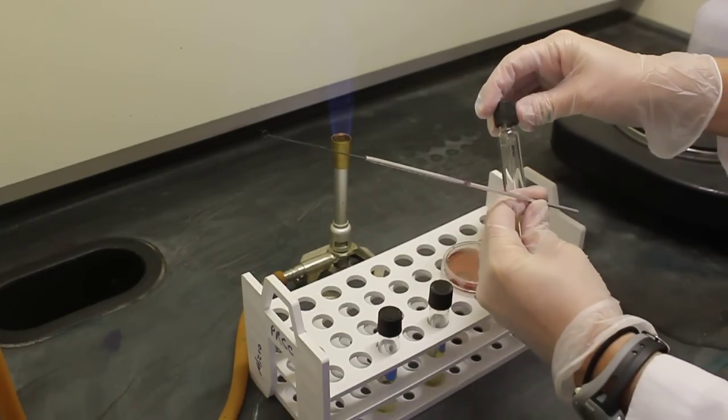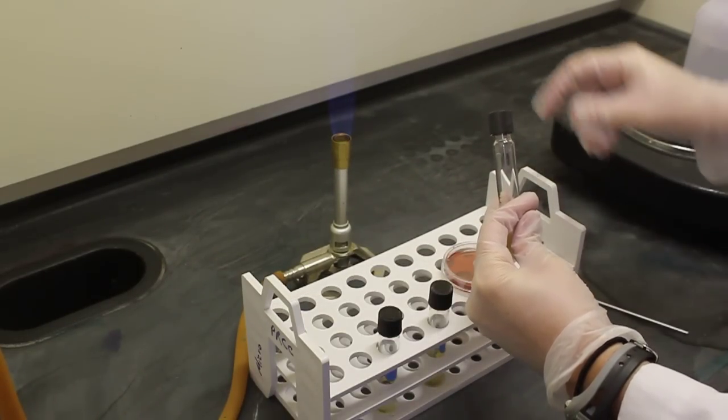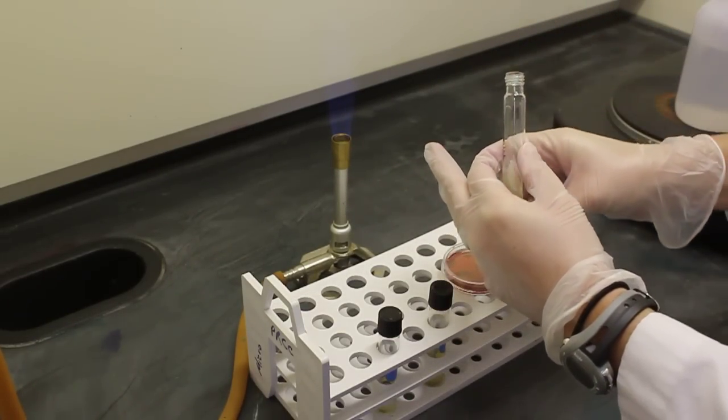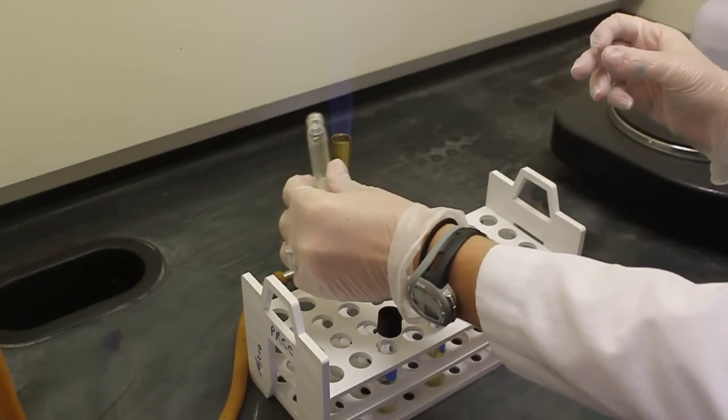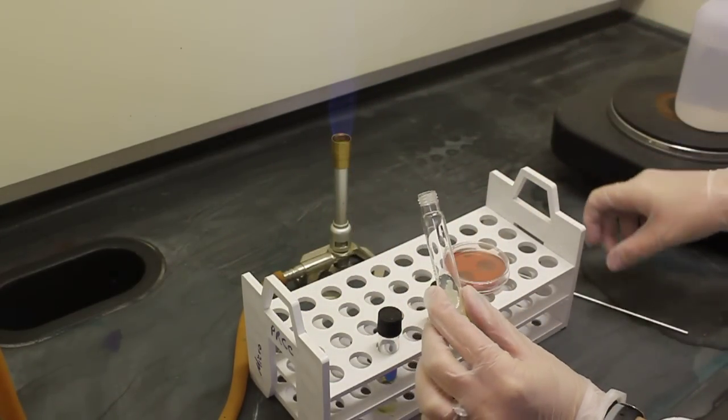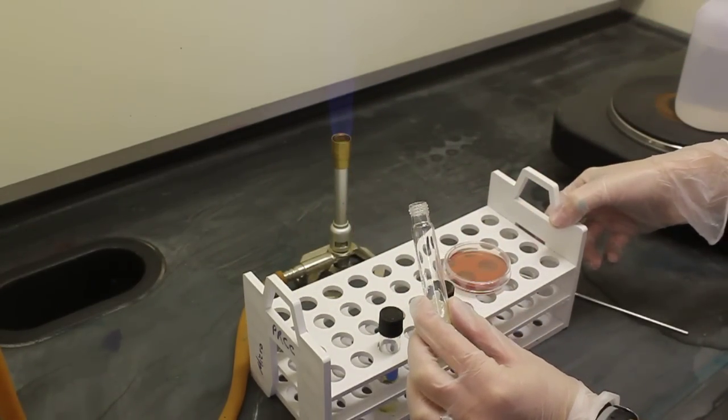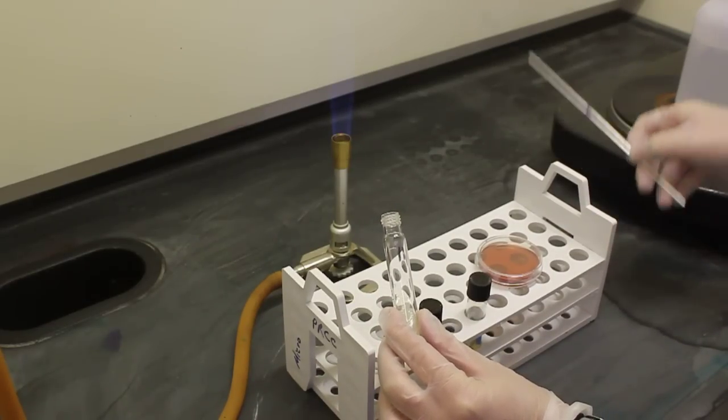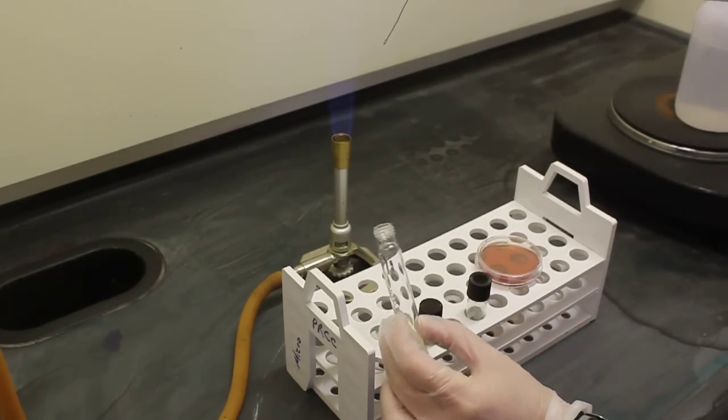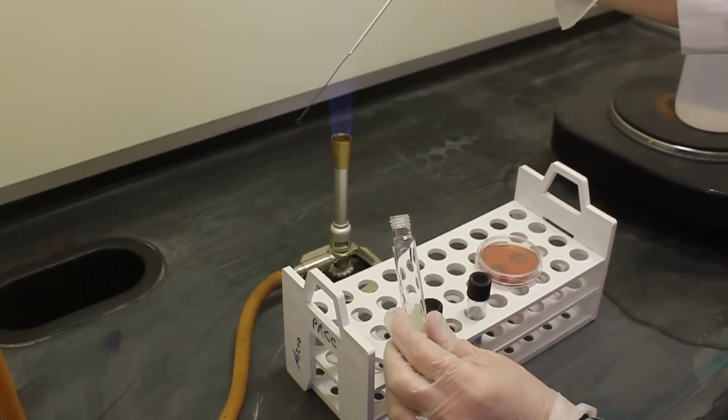When I open my stock culture, I need to place the lid in my pinky and run the test tube through the flame. I am now going to sterilize my loop.